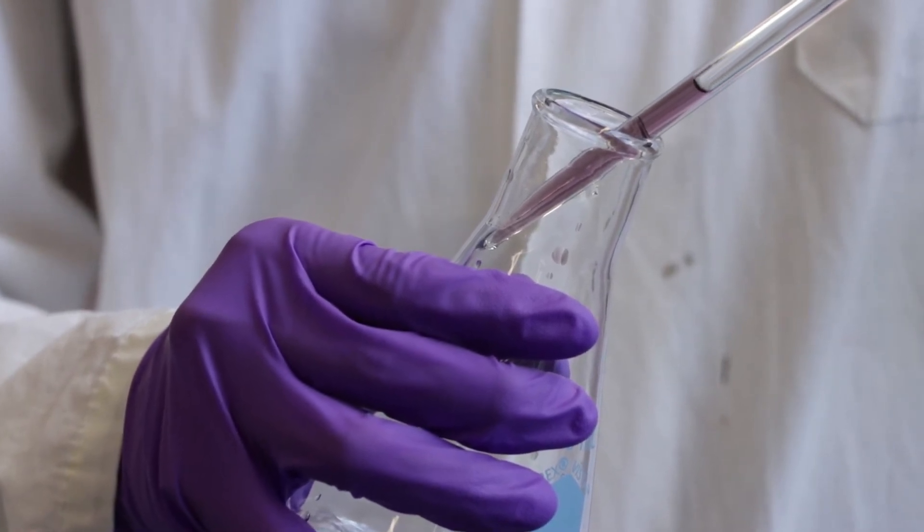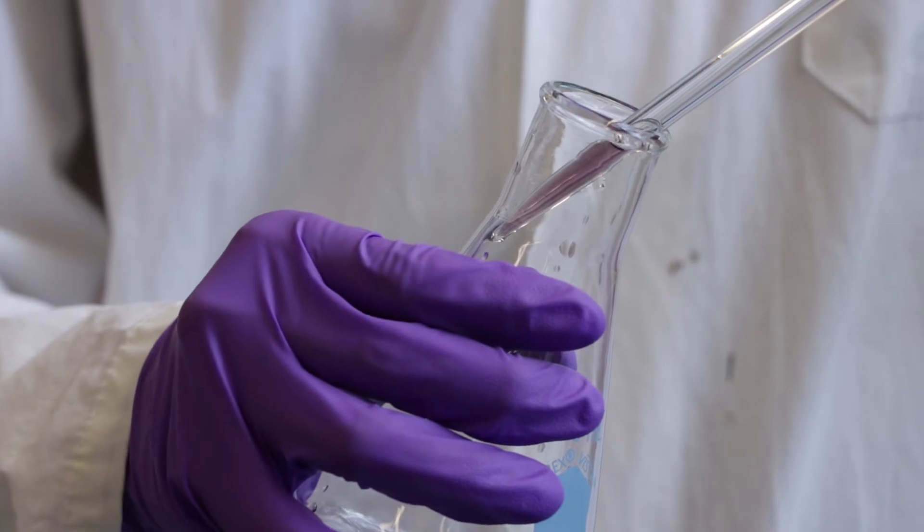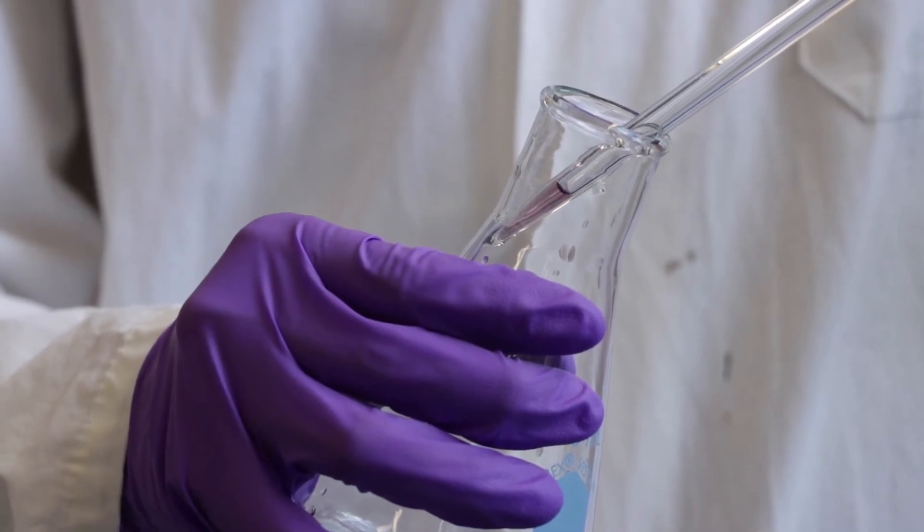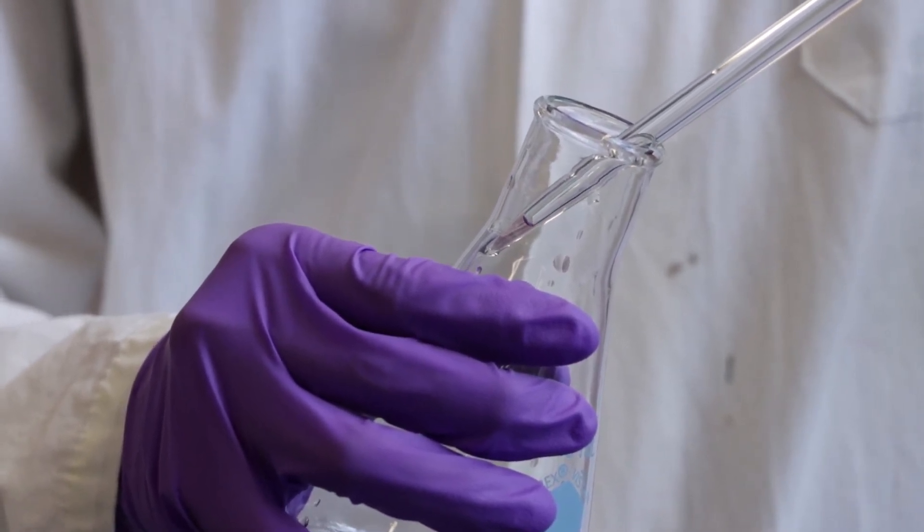You'll notice that a small volume of liquid will remain in the tip of the pipette. Do not blow this out. The pipette has been carefully calibrated to take this small volume into consideration.